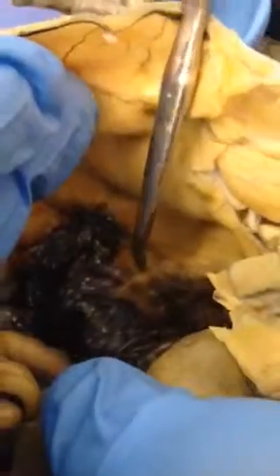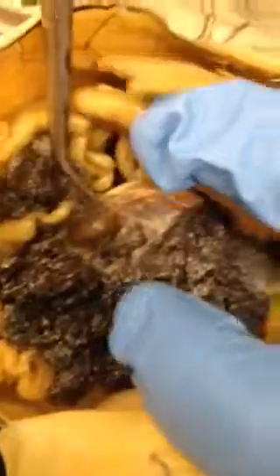Hold on, this is a funky angle — right there, this thing. Looks like a giant raisin. The spleen — there it is, the spleen is right here. The fat bodies are right here; they're pretty much everywhere inside of the abdominal cavity.